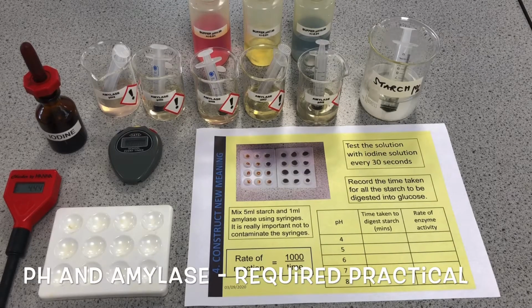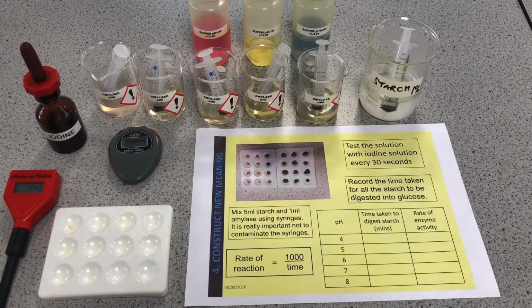This is a video for the pH and amylase required practical from the topic B2. It's looking at the effect of pH on the activity of amylase breaking down starch. So we've got starch, this long chain molecule that's insoluble, so it doesn't dissolve, and we're trying to digest it into sugar, into glucose, using amylase. And we're trying to find out in this practical what is the best pH for amylase to work at, and how does pH affect the activity of the amylase.